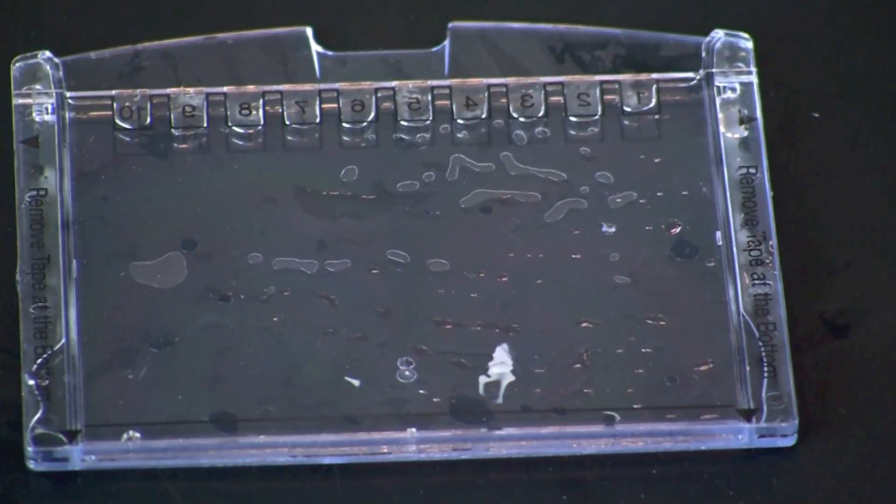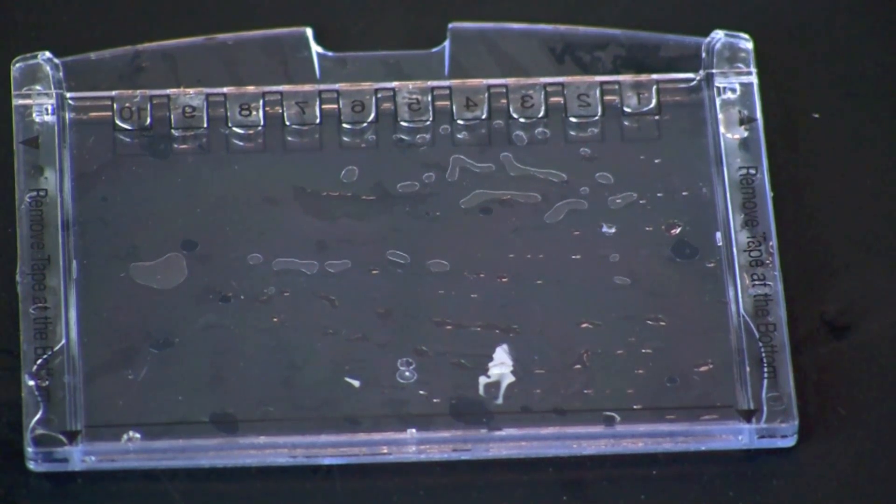Notice the gel has two plates, a short plate on one side, and a long plate on the other.